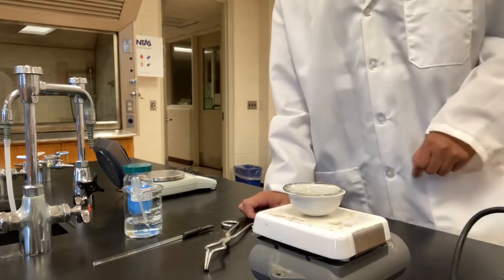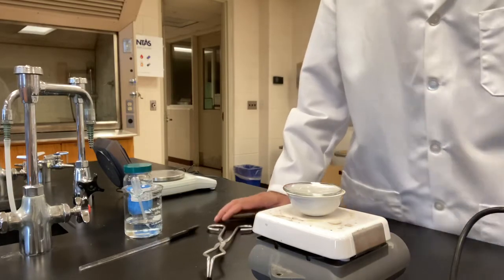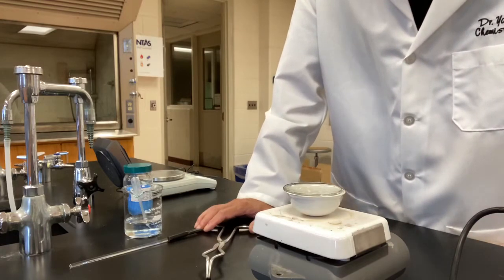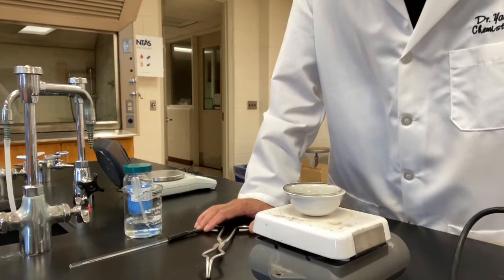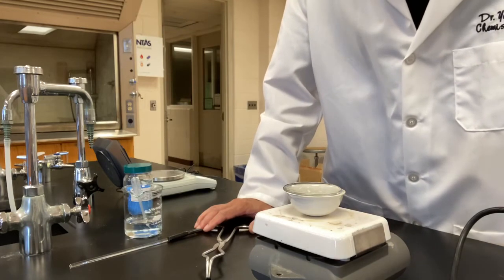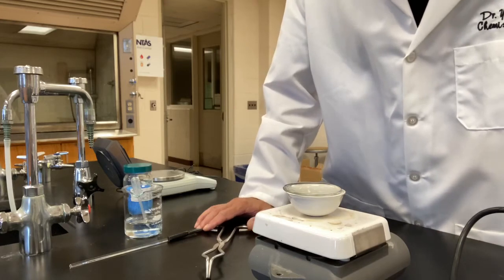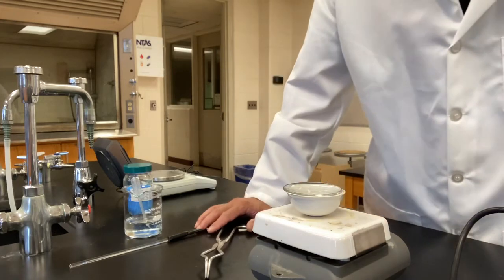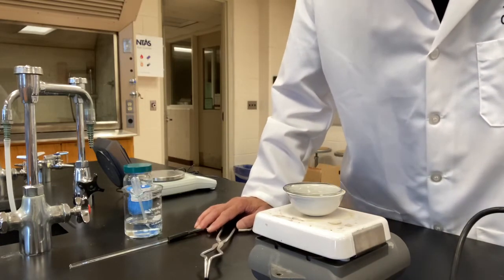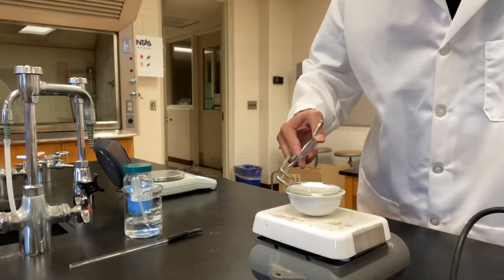Remember, the sample we put into the evaporating dish originally has a blue color. They're blue colored crystals. When the water is all gone, the anhydrous copper(II) sulfate should be a pale white color. The pure one should be white colored, solid. But there might be some impurities in the sample, so the sample may show some kind of gray-white color. So let's take a look at our sample right now to see how it looks.